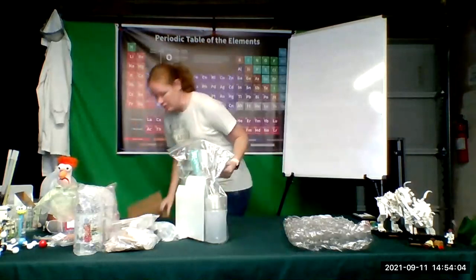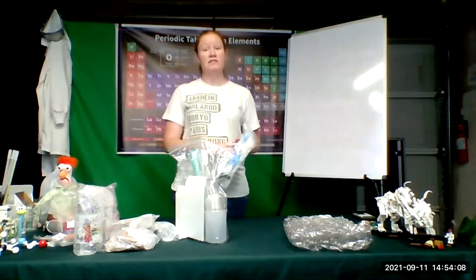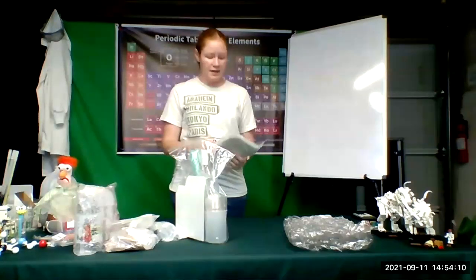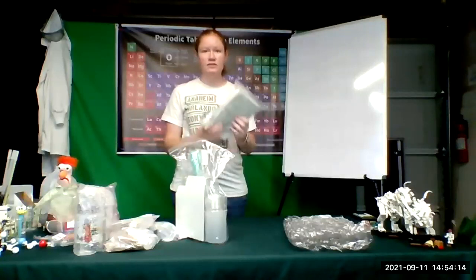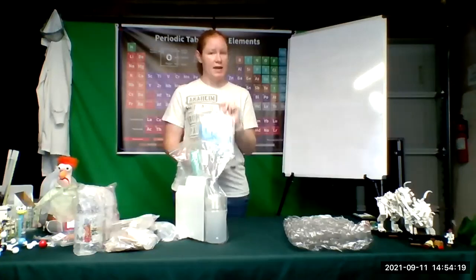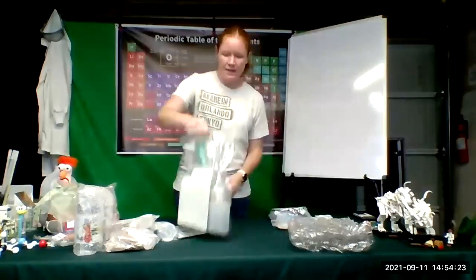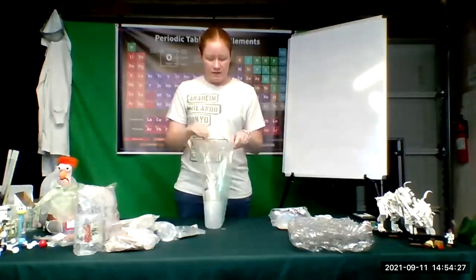Okay, set this box down. So your safety set will have a bunch of gloves so that you can have a fresh pair of gloves for each experiment. It's going to have a pair of lab goggles, and it's going to have a lab apron. Okay, so these are the items that you will need to wear when you're doing all of your experiments. You'll need to have your apron on, your goggles on, and a pair of gloves on. Okay, and then these are all the tools that you will use for your various experiments.